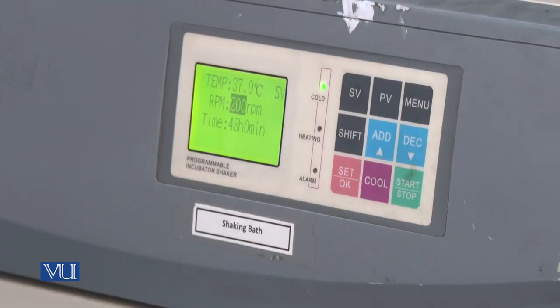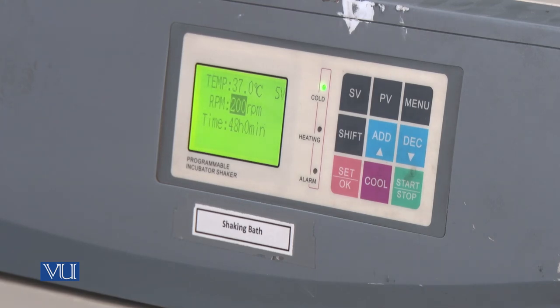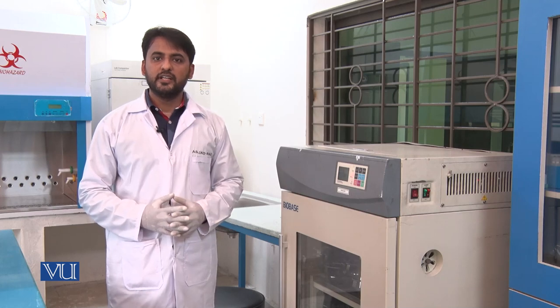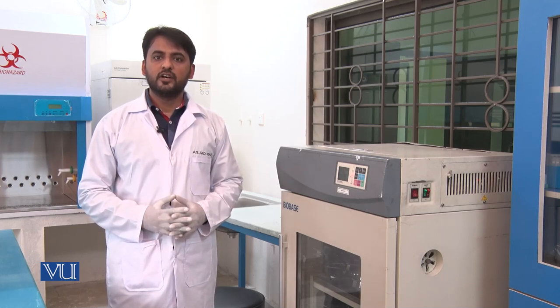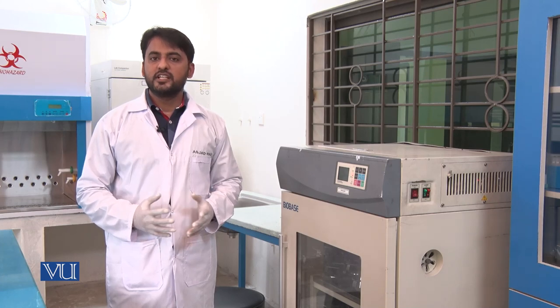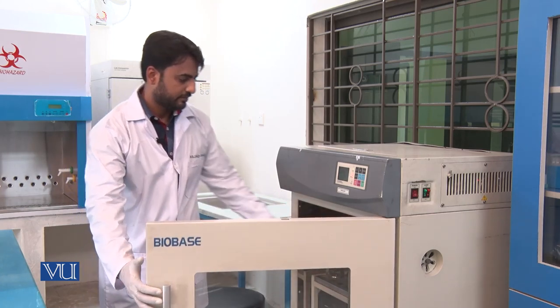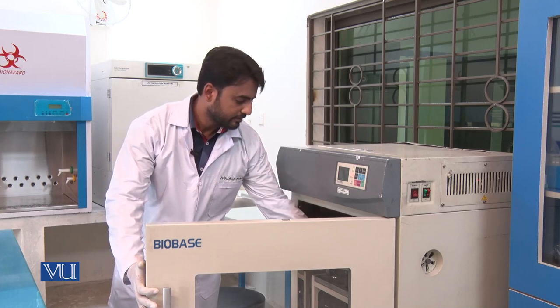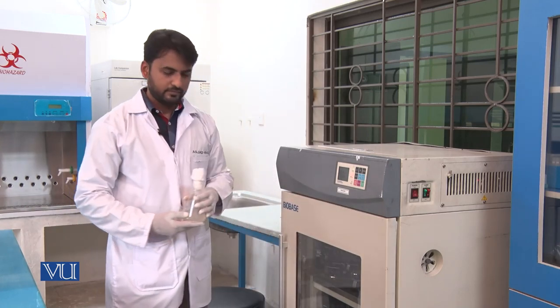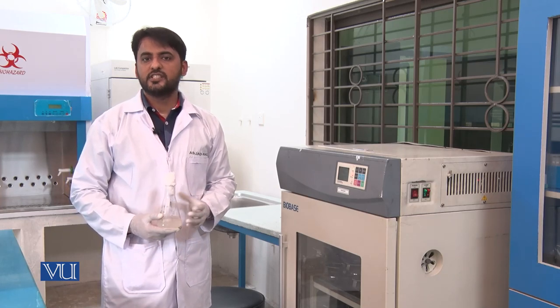As 48 hours has been completed, we will now take out our flask from the shaking incubator and pour our inoculated media into different falcons of 15 ml capacity for centrifugation. Now let's move toward the next step which is centrifugation.